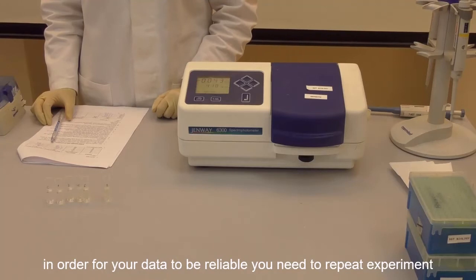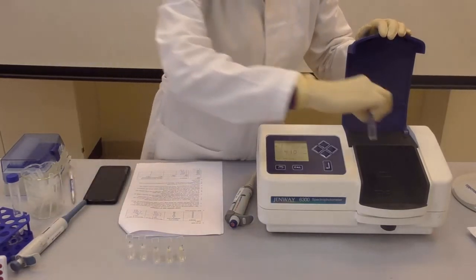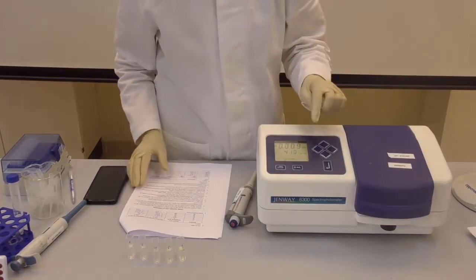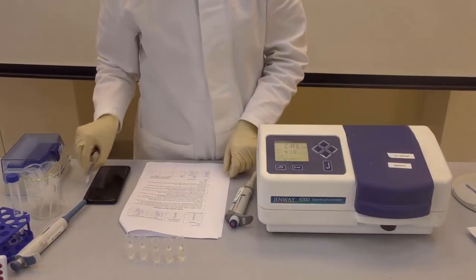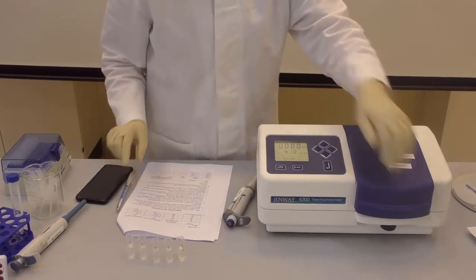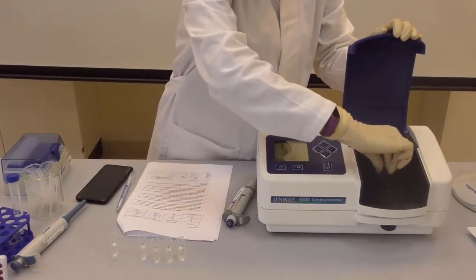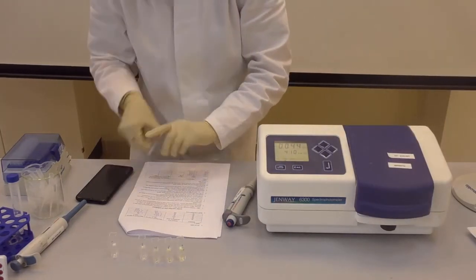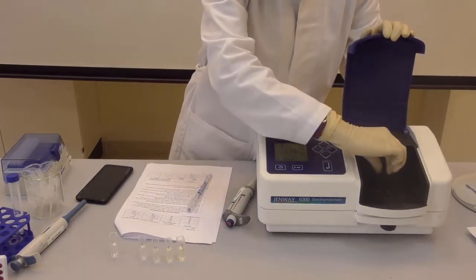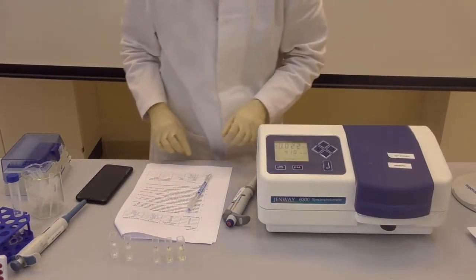In order for your data to be reliable, you need to repeat the experiment one more time. Of course, the control cuvette will be different from the previous set of measurements. Increasing the number of replicates of the experiment will give us the possibility to average the measurements and obtain the most reliable results.